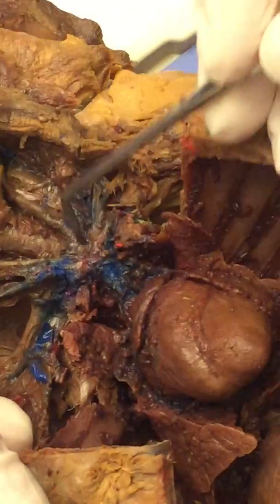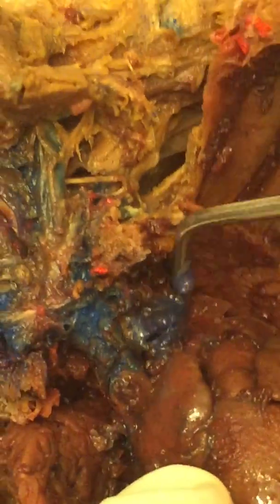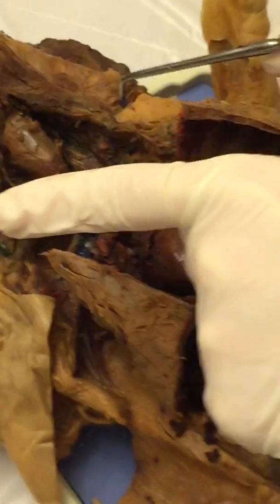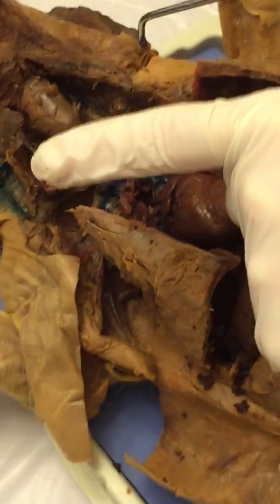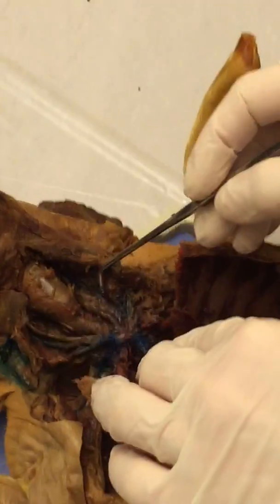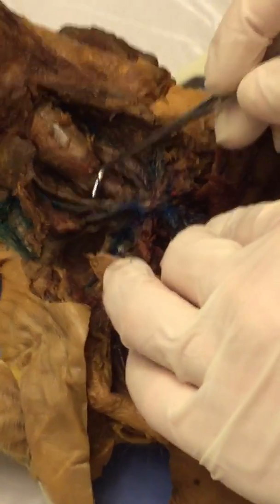this fetal pig. So what we have in the heart is, if you look way back in here, you can see the aorta, which is a little difficult. I can't really point it out well because there's some blue gunk in the way. But what you'll see is there's the aorta, and then the first branch off of that aorta is the brachiocephalic artery. The brachiocephalic artery then bifurcates into the right and left common carotid arteries in the pig. So that's where these guys are coming from.